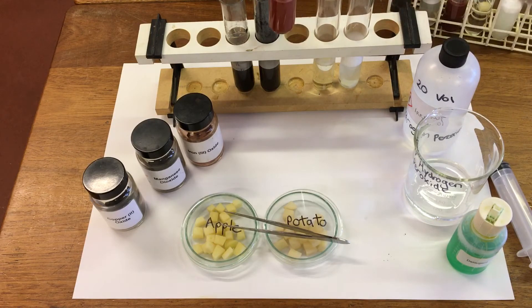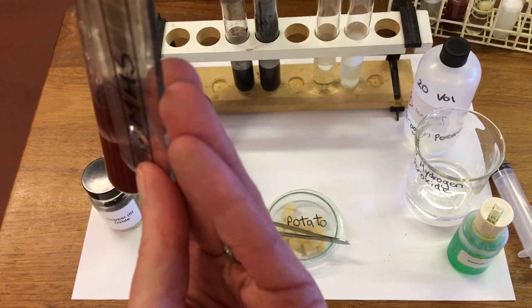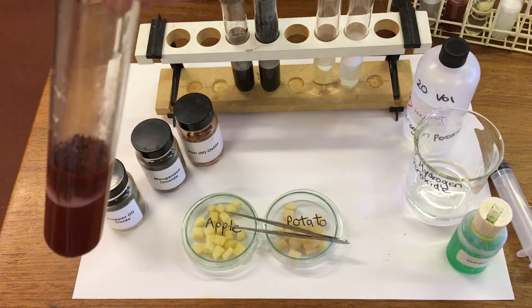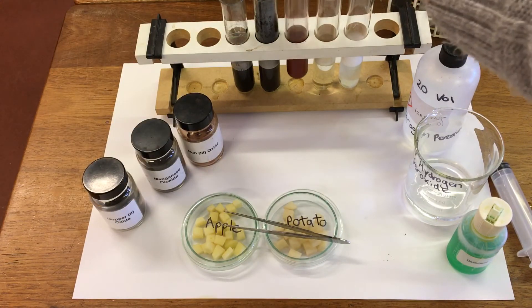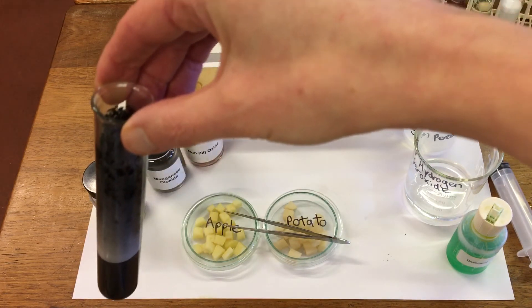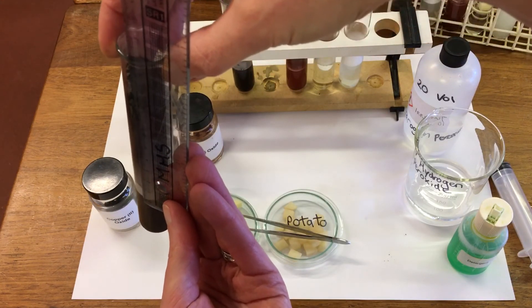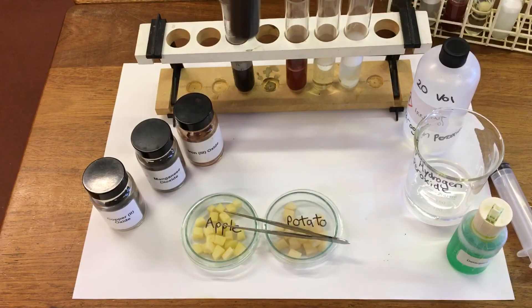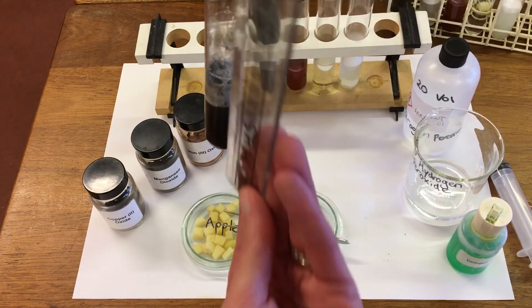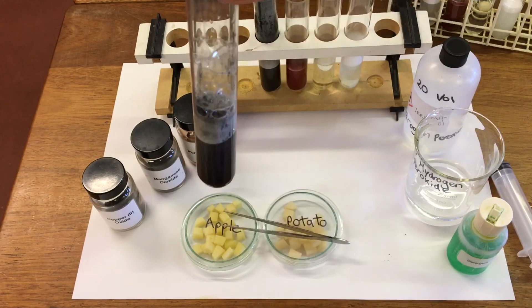Then we've got our iron oxide — after five minutes we've got 2 centimeters of foam in that one. And the copper oxide — after five minutes that one's got 2.5 centimeters of foam in it.